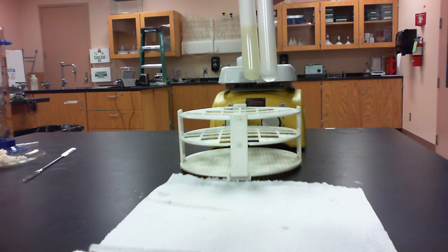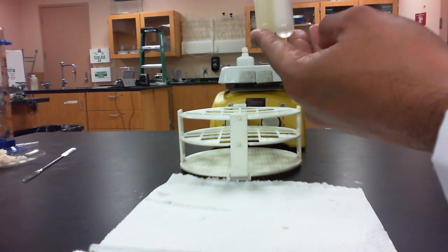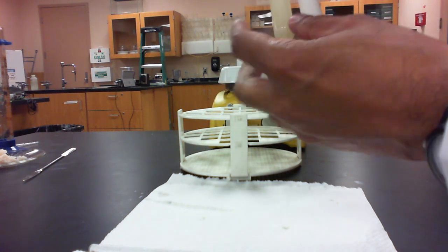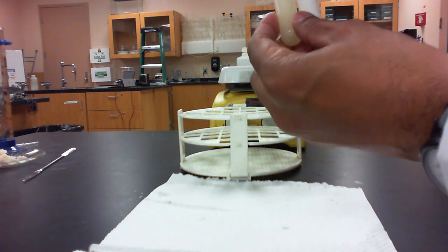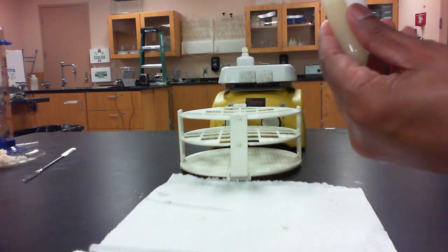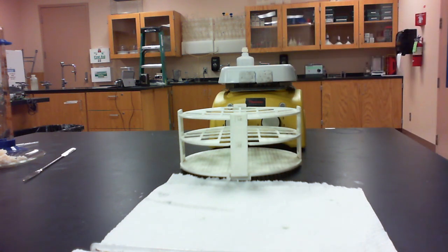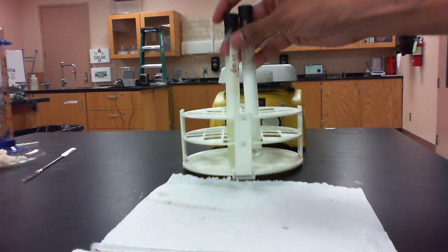How much of the soap did the vegetable oil that we added actually dissolve? And if you look on the left side here, you can actually see some of the olive oil soap remaining here at the top, where it looks like on the vegetable shortening soap, most of it is actually dissolved.